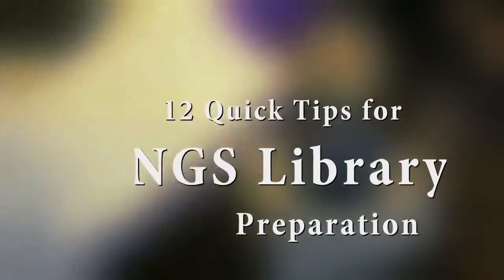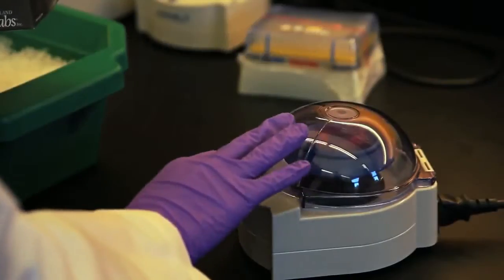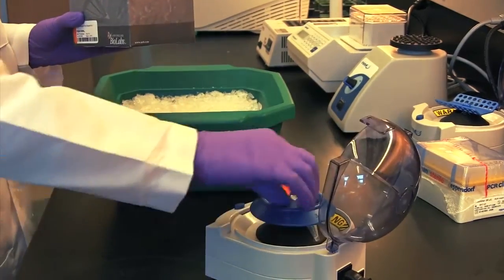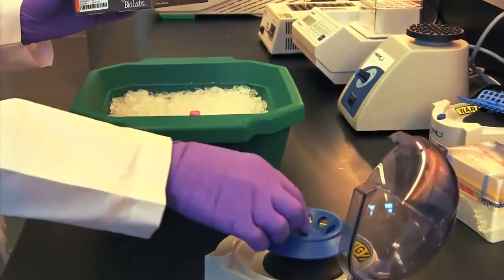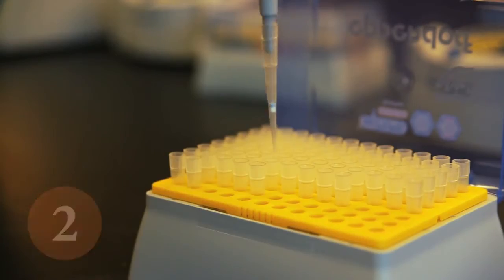Here are 12 quick tips for NGS library preparation using NEBNext products. Don't forget to spin down the vials before opening. This ensures everything is at the bottom of the vial and not in the cap or on the sides. Make sure you use filter tips to minimize contamination.